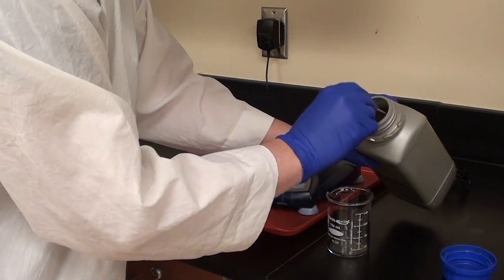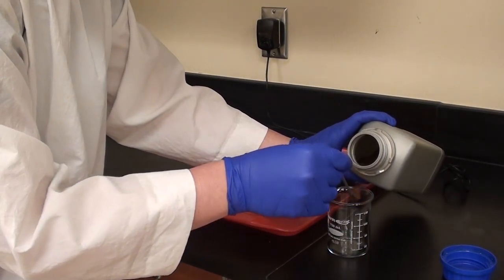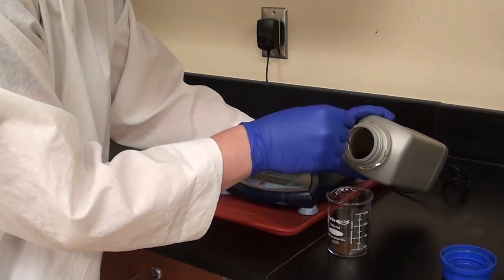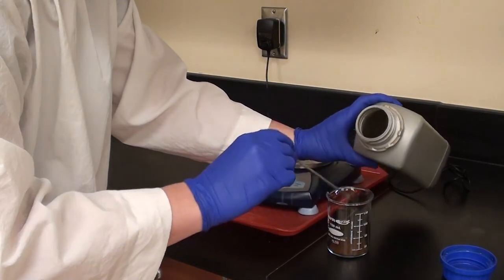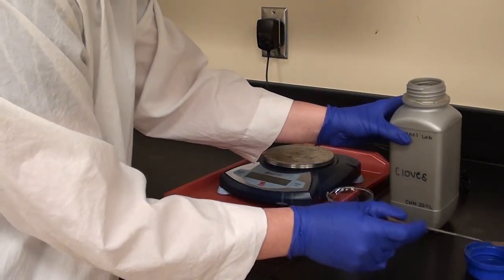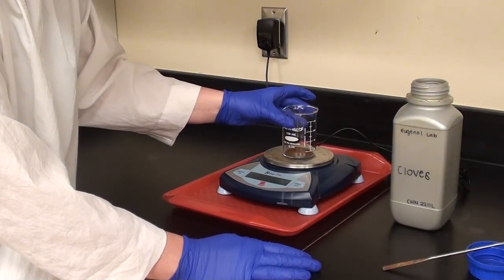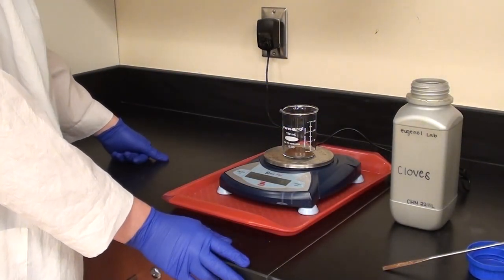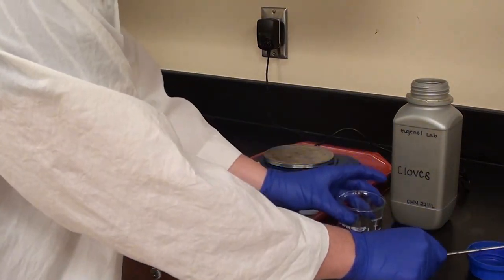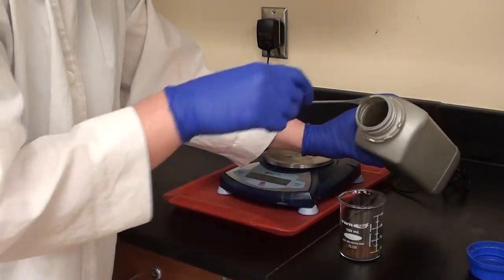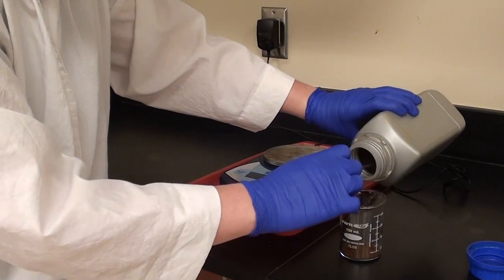We need about 25 grams, but she's going to put in a few scoops just to get an idea of how much we're adding. Let's put it on there and we'll see how much we've got. It's about three grams. So we know we need about eight times what she's got there. You can just scrape it out.